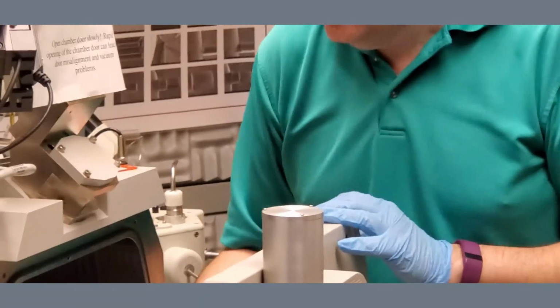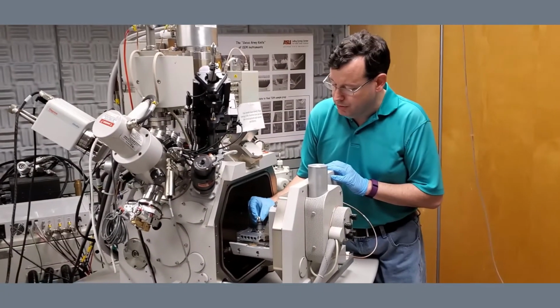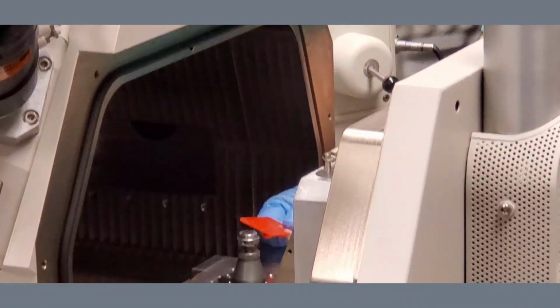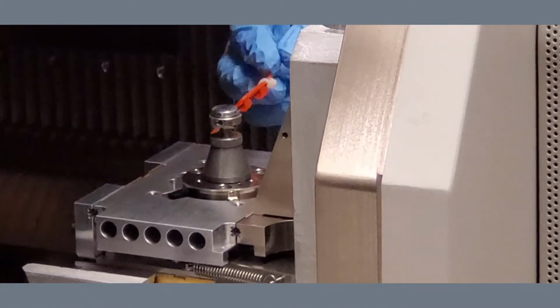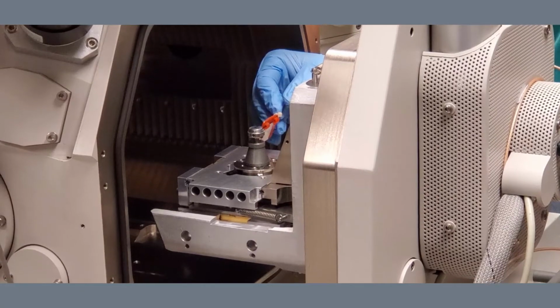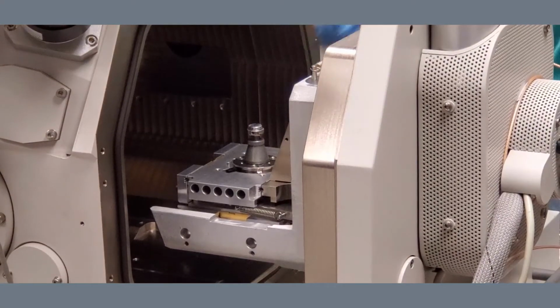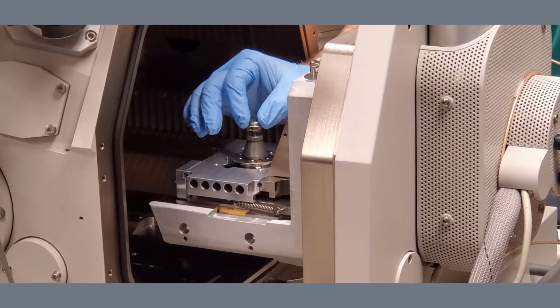And the stage area here has a hole on top. You're simply going to slide the pin into the hole, tighten down the set screw that's on the side, finger tight. It's a small screw, small fine threads. If you put too much pressure on it, you'll strip it. So just basically just finger tight. Check to make sure that it is solid, that it's not wiggly or wobbly.